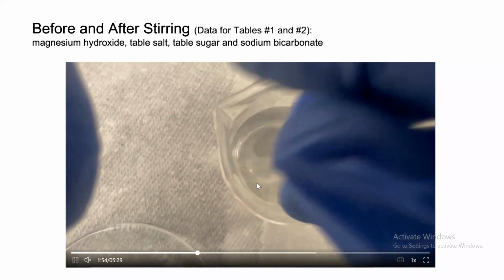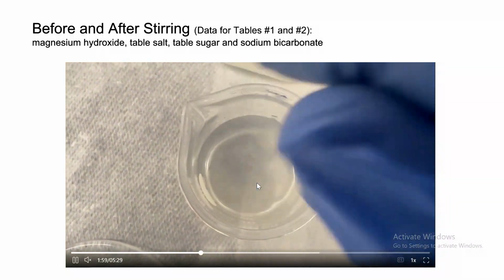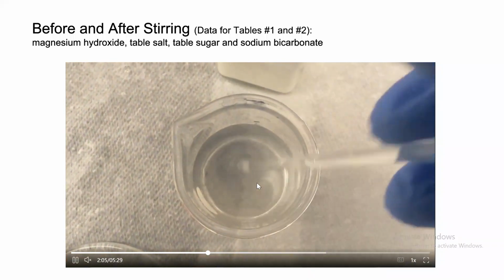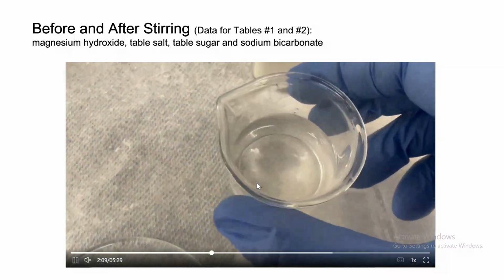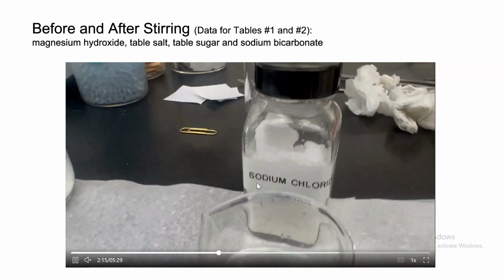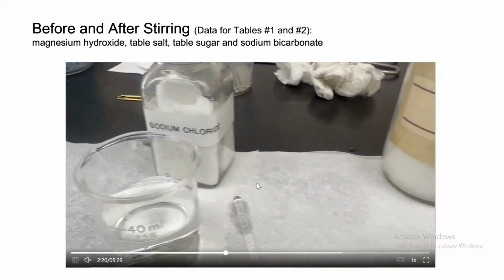So you're going to write table salt dissolves and soluble. See, as we're mixing, the salt is disappearing. So we say this is a homogeneous mixture. Everything is evenly mixed. So sodium chloride, which is the formula for salt, dissolves in water.